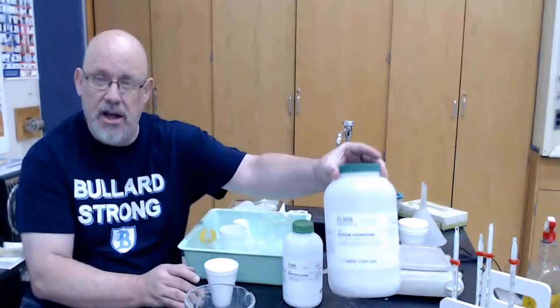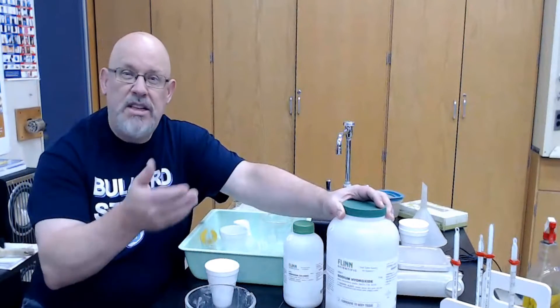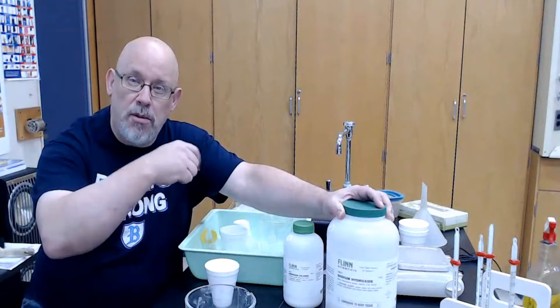The sodium hydroxide is right here. It comes out looking like little pieces of soap, as if you took a bar of soap and use a razor and cut off some flakes of it. It's highly reactive with the atmosphere and just a tad dangerous if it gets on your skin. So during the lab, if you ever feel an itchy or soapy sensation on your fingers, just wash your hands and reduce any risk down to zero.